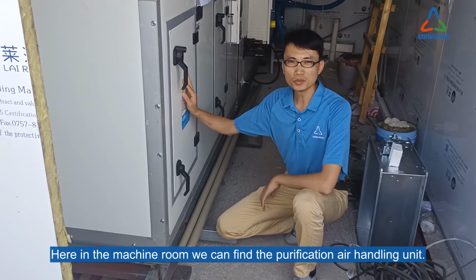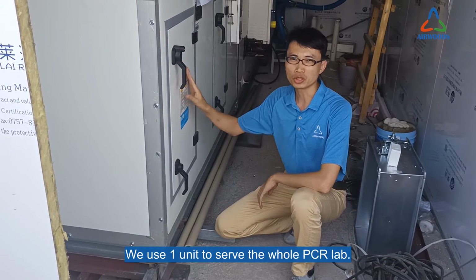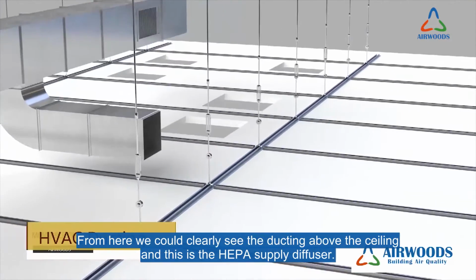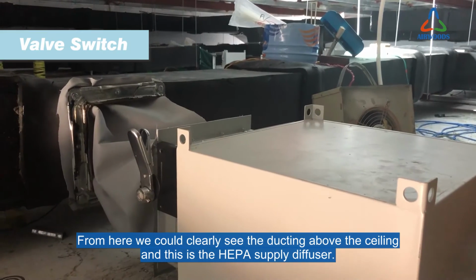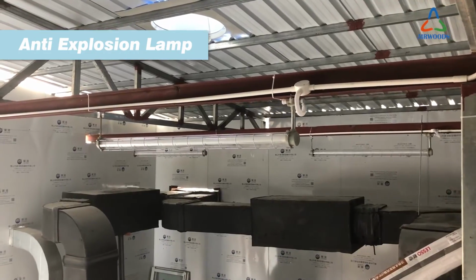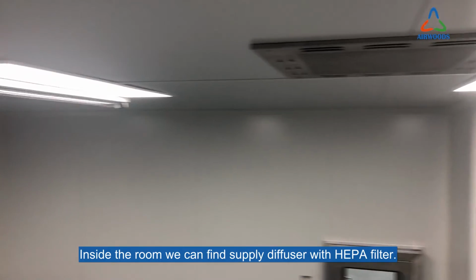Here in the machine room, you can find the purification air handling units, and we use one unit to serve the whole PCR lab. From here, we can clearly see the ducting above the ceiling and also the HEPA supply diffuser. We can also see the valve switch and anti-explosion lamp. Inside the room, we can find the supply diffuser with HEPA filter.